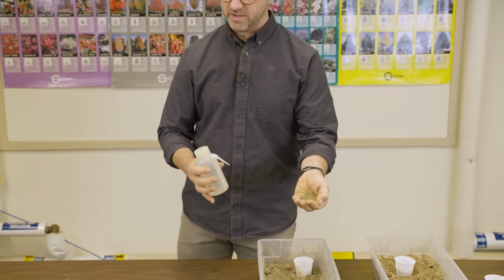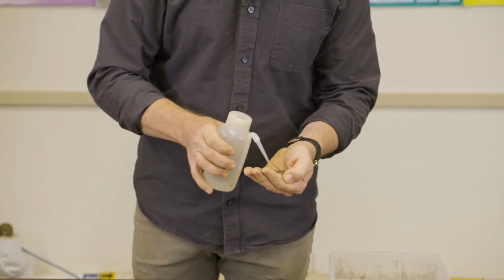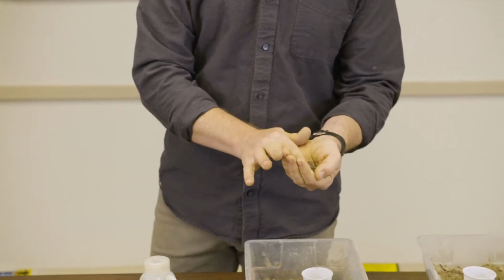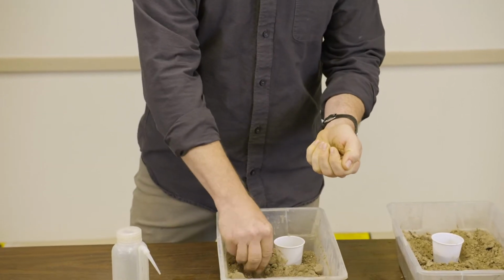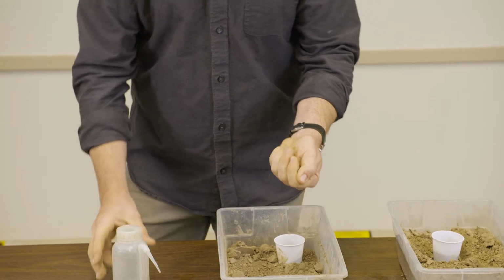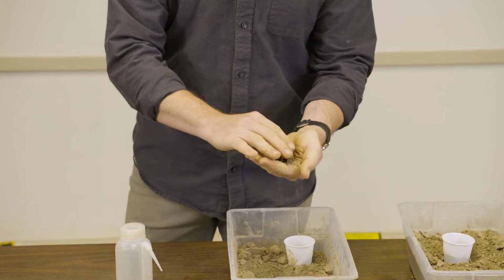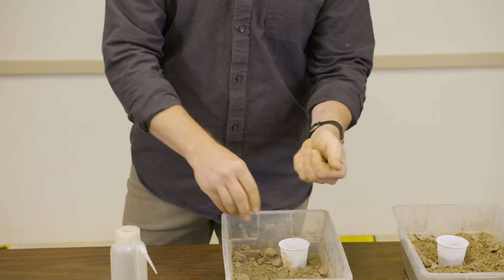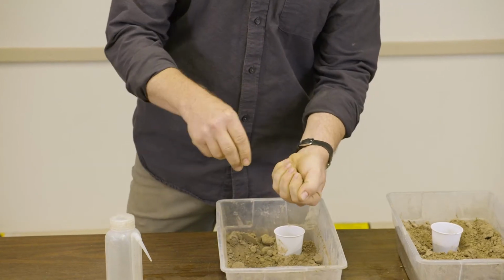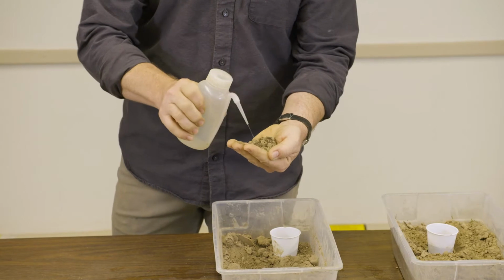I'm going to wet the sample. I'm going to place just a couple drops. The goal here is to form a ball. I want to get a ball of soil that's roughly putty-like in consistency, something that kind of holds together. So we're just going to keep wetting until we get there. Let's add a little more soil. We want about a little golf ball size, so we have enough to run our diagnostic on.